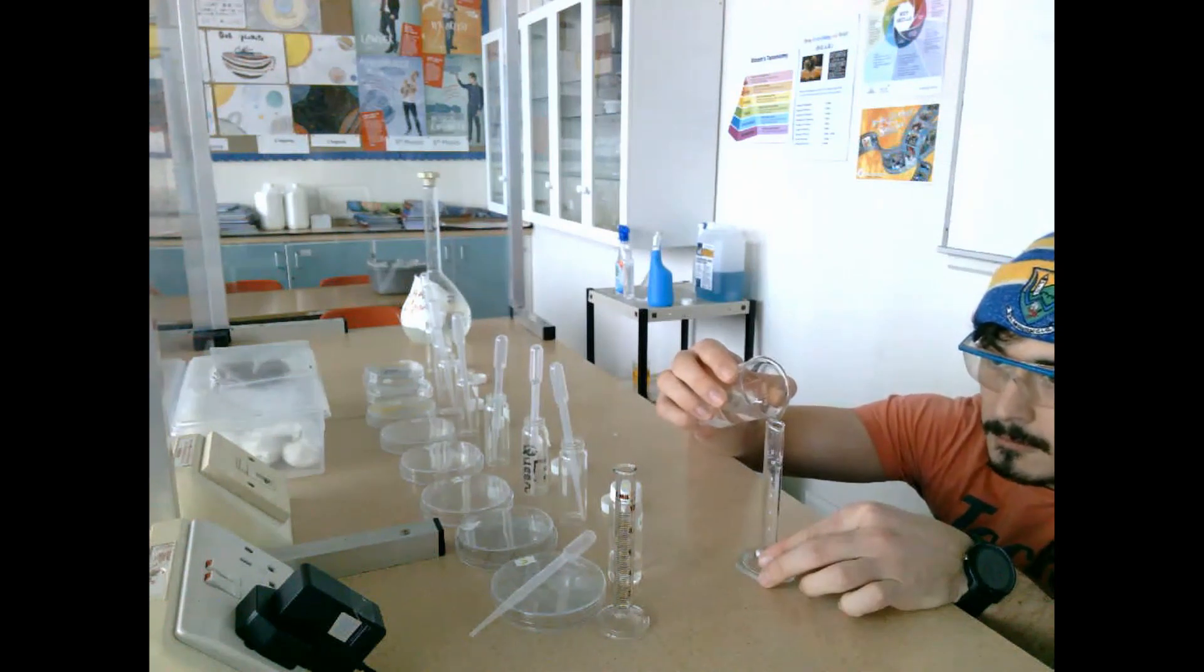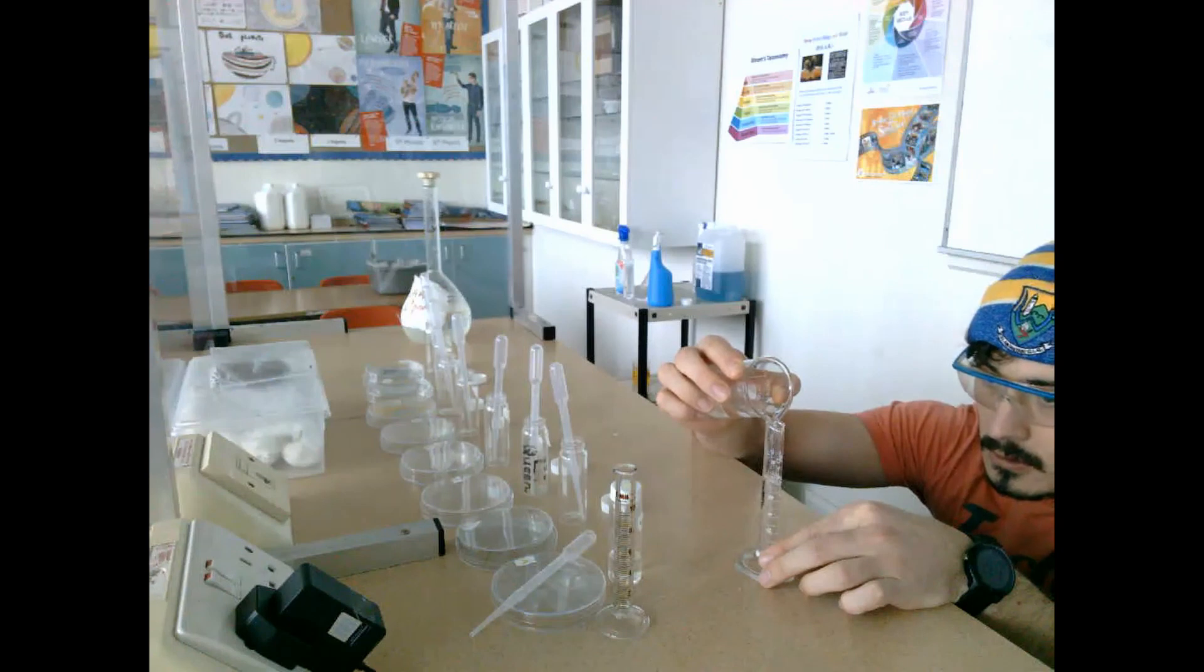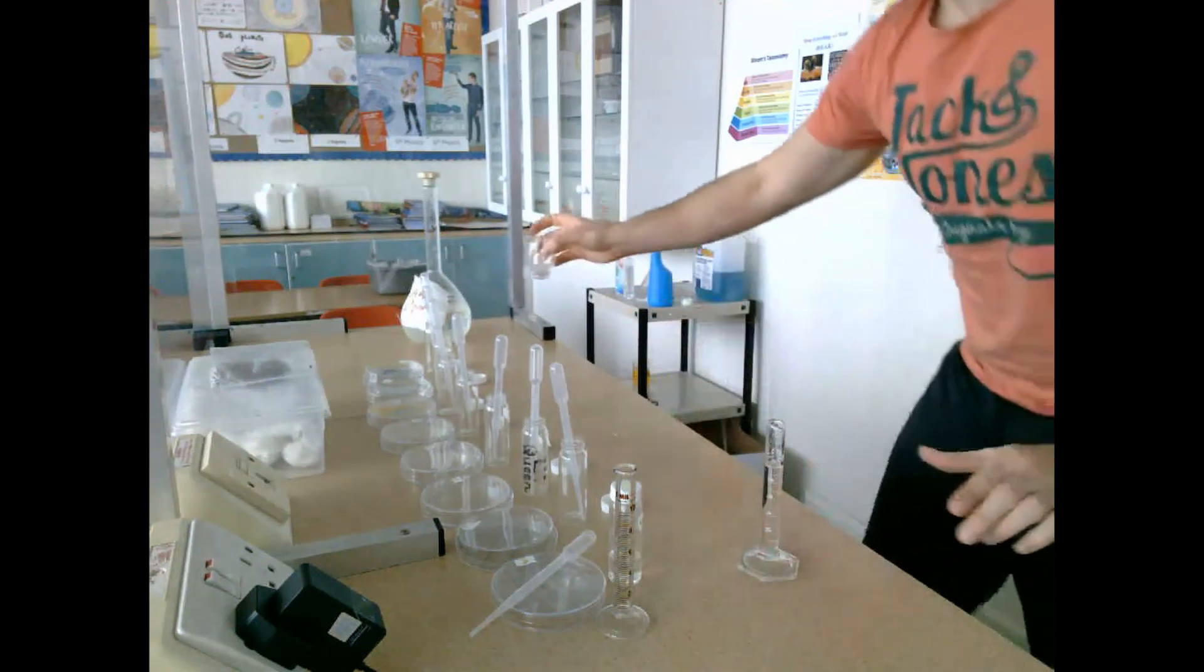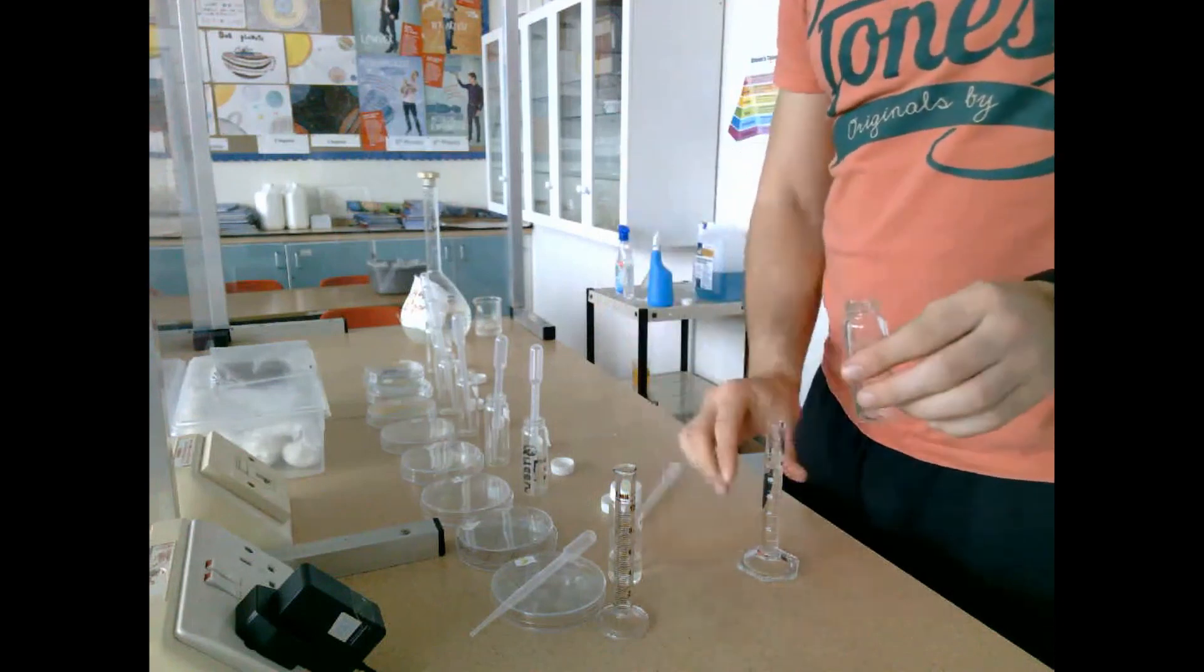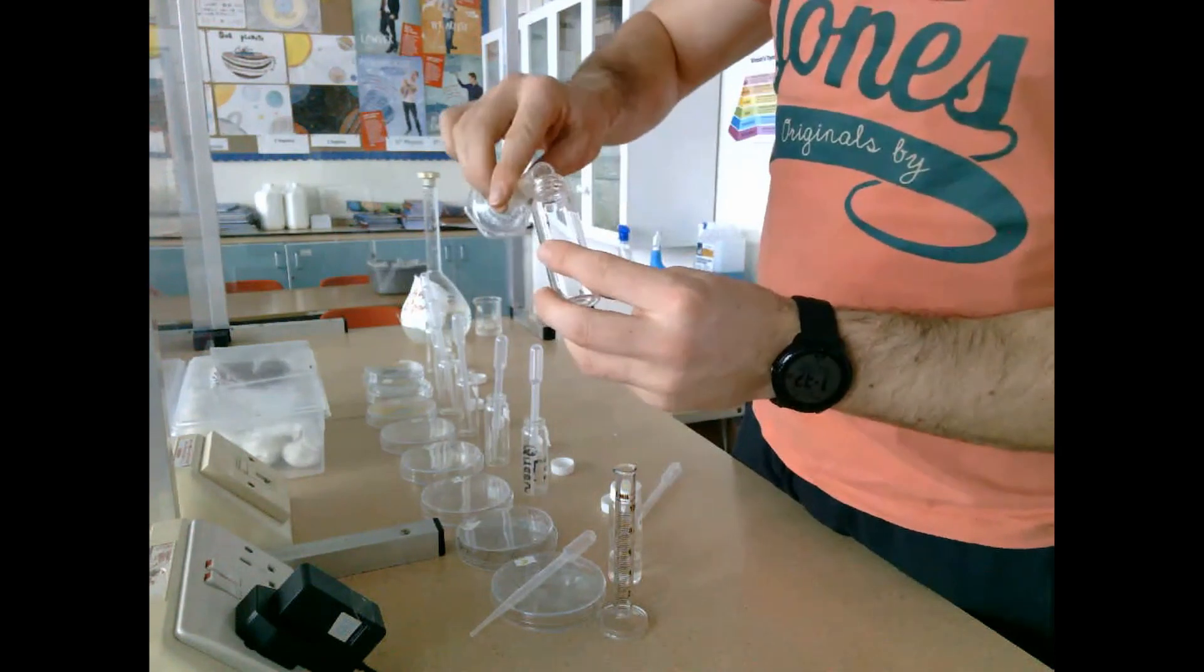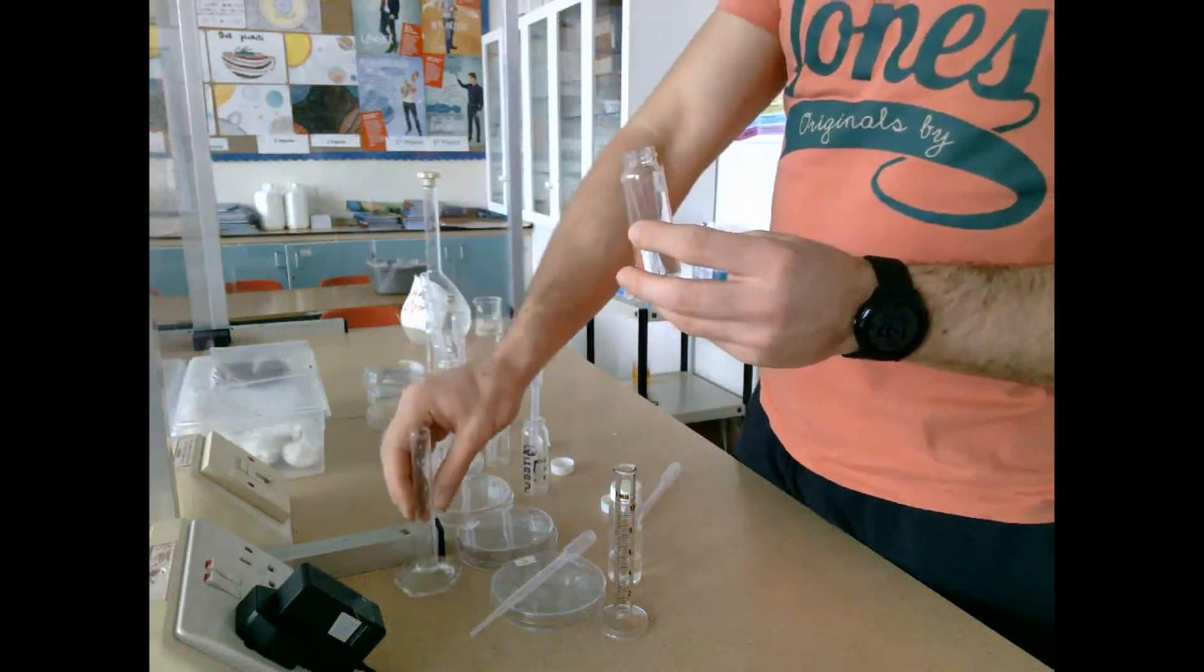The point of this experiment is to see what effect different concentrations have. We're going to measure this effect by comparing the growth of the radish seeds in each plate to the control plate that we began with.